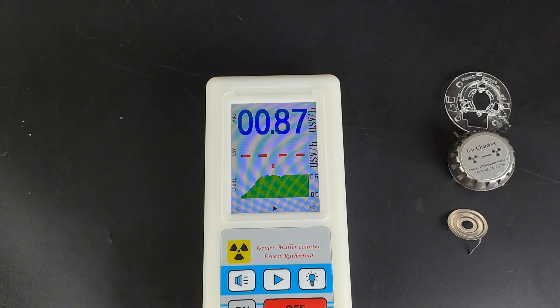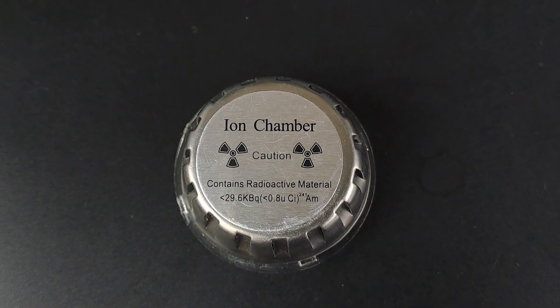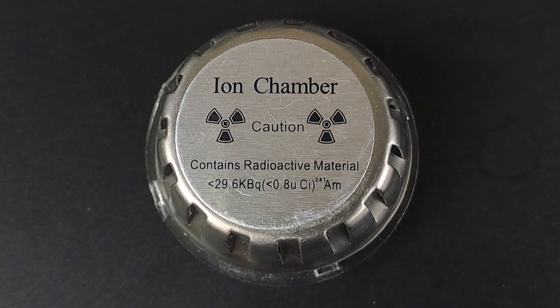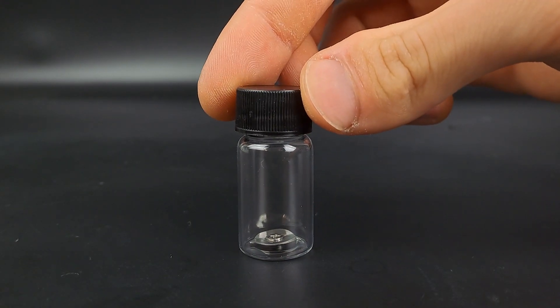Less than 29.6 kBq of americium-241. Well thanks, that could be like 50 Bq. It would be quite surprising if it really had 29 kBq of it.